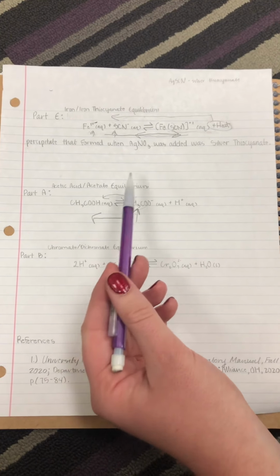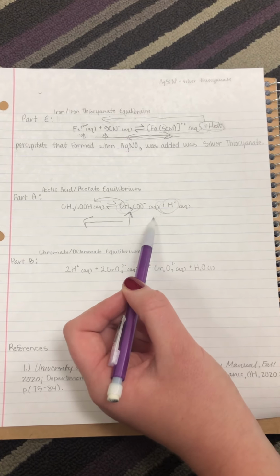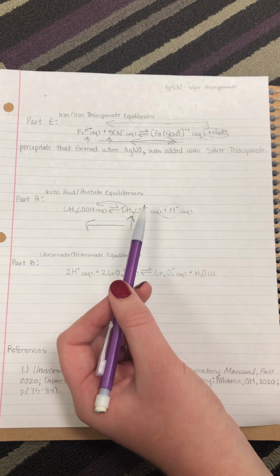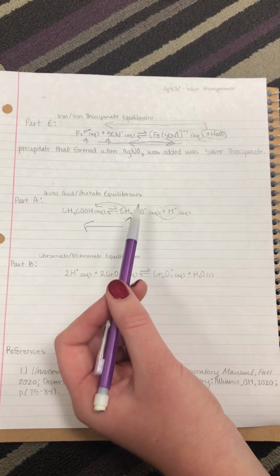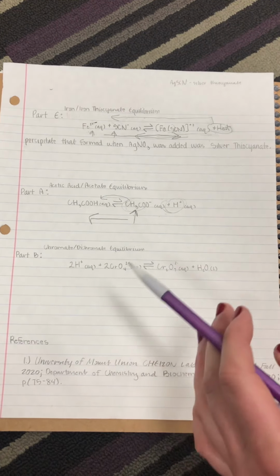This is from the decrease of concentration of the hydronium ions on the product side. The evidence proven was that there was a shift in the pH levels when sodium acetate was added to the acetic acid, which justifies how the equilibrium was established. The pH shifted from 4 to 6 with the addition of sodium acetate.